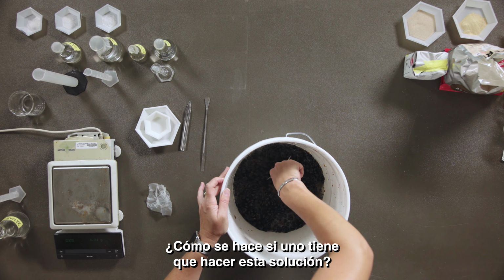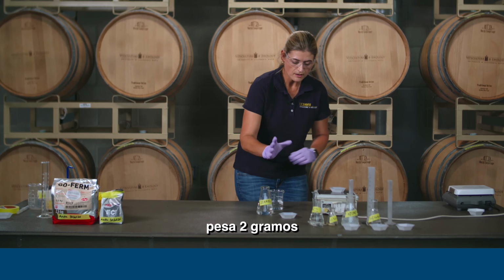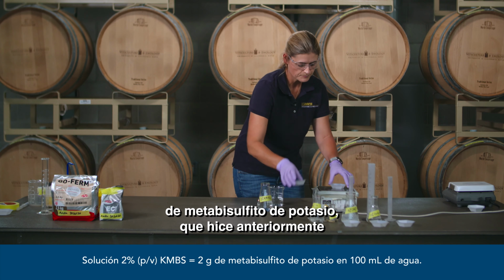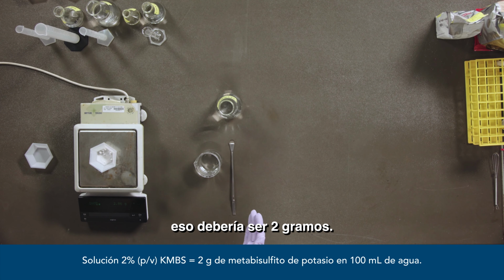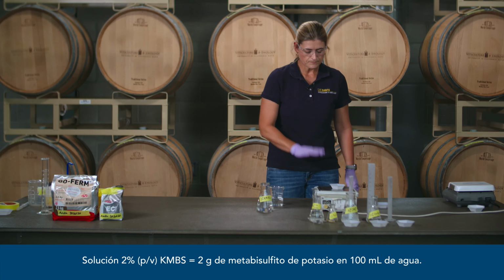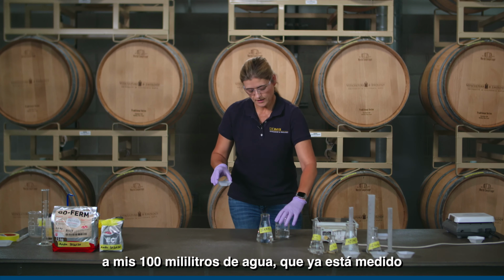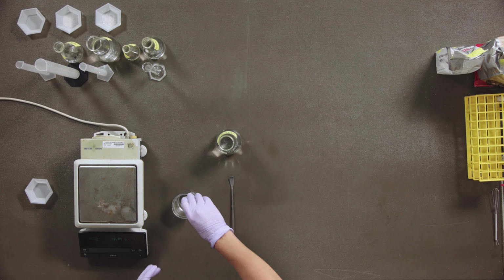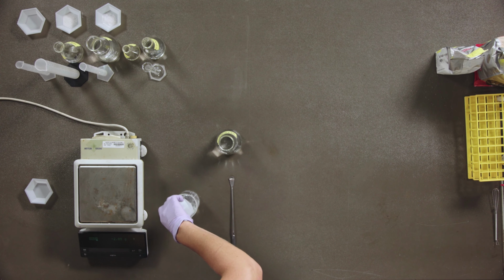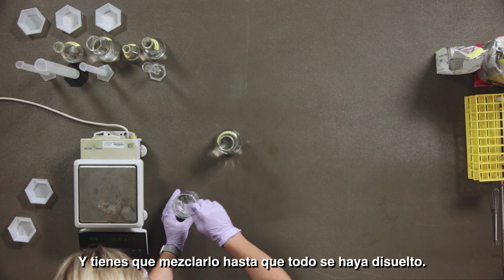Now, how did I make the solution? If you have to make the solution, I will weigh off 2 grams of potassium metabisulfite, which I've already done. So that should be about 2 grams. Yeah, that's close enough. This I would stir now into my 100 milliliters of water, which I've already measured out. So just dump it in there. And you need to stir it until everything has dissolved.